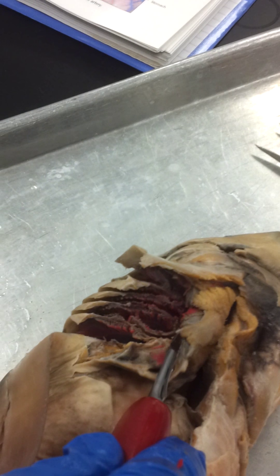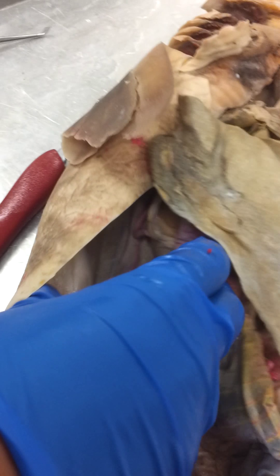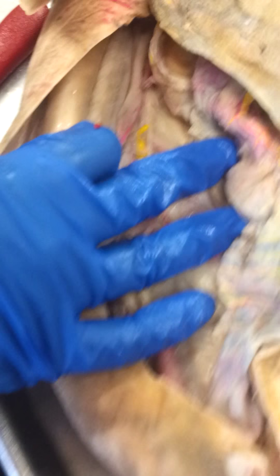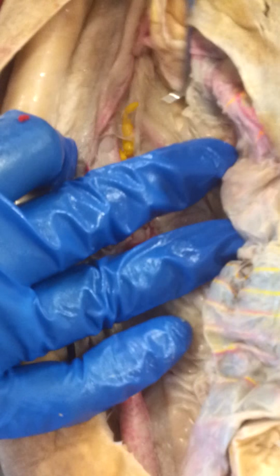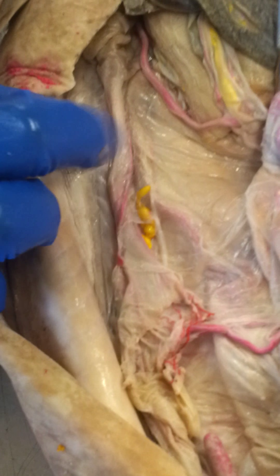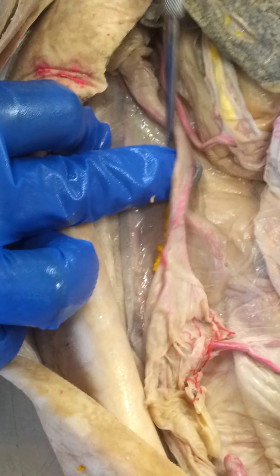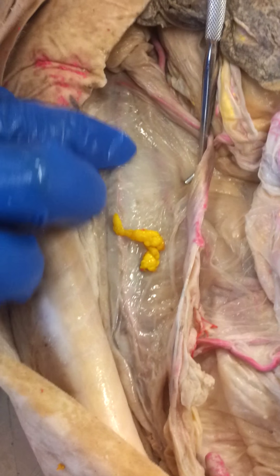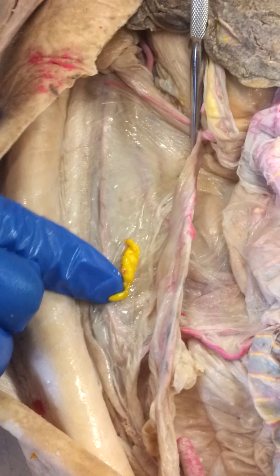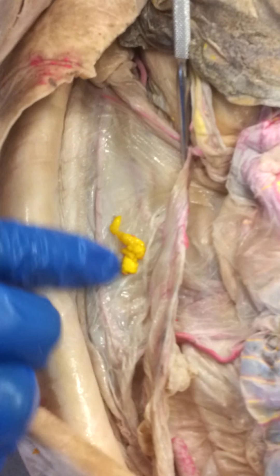From the efferent branchial arteries, your blood is going to run down to the dorsal aorta, which runs the length of the body and can be seen right here. That's your dorsal aorta.